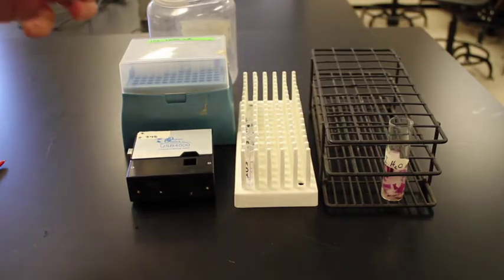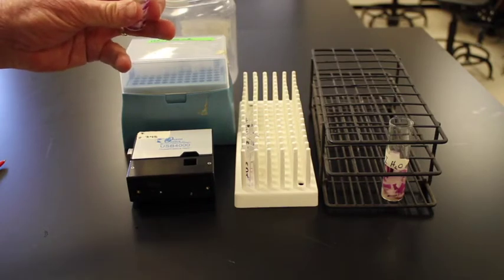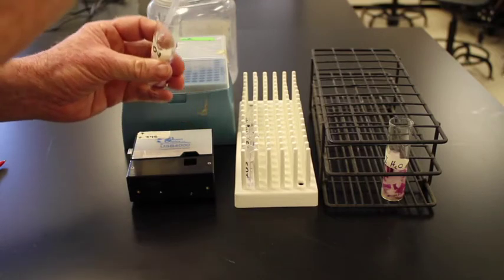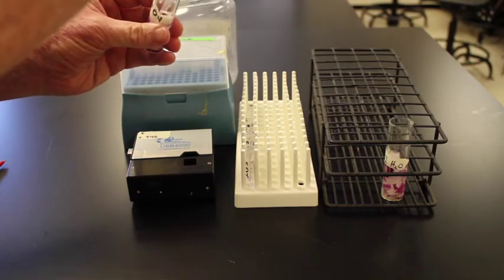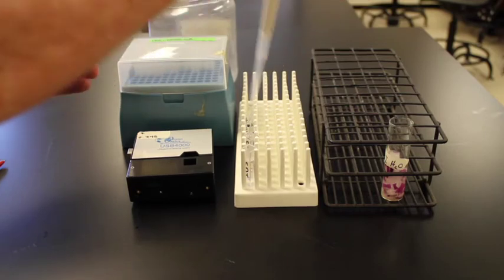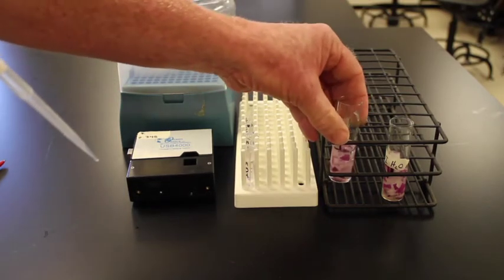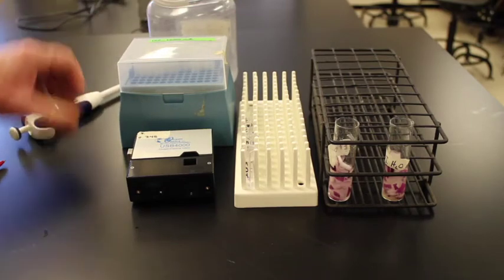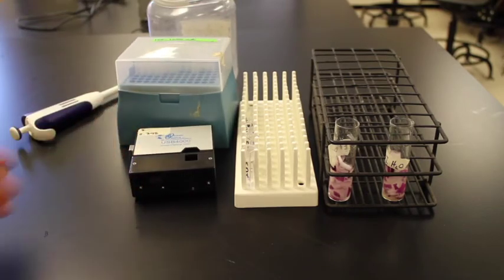Okay, a little bit of drill here. 2, and our 3rd milliliter. 3 milliliters of that. And now I'm going to go hook the spectrometer to the computer and we will do the analysis.